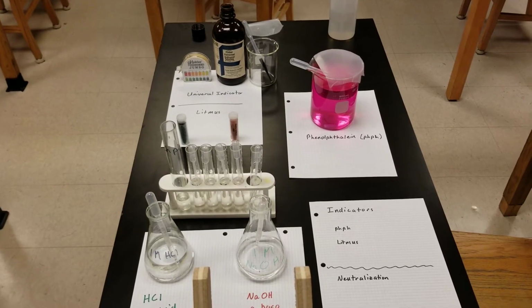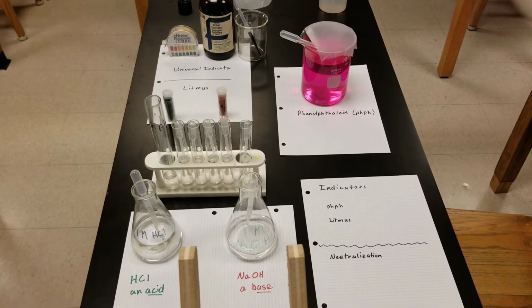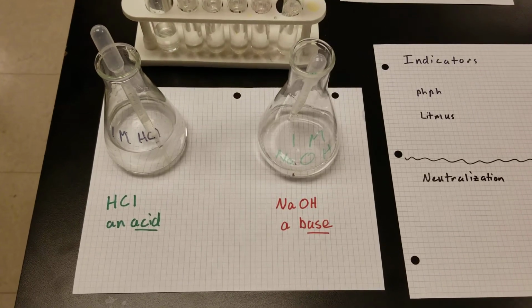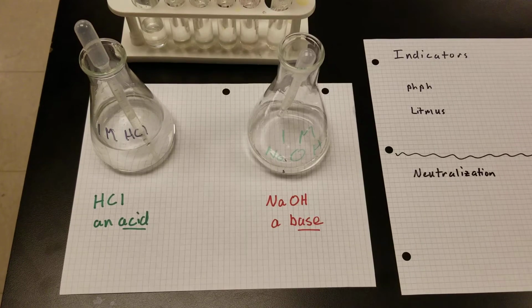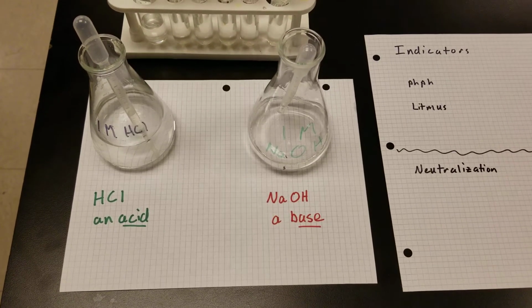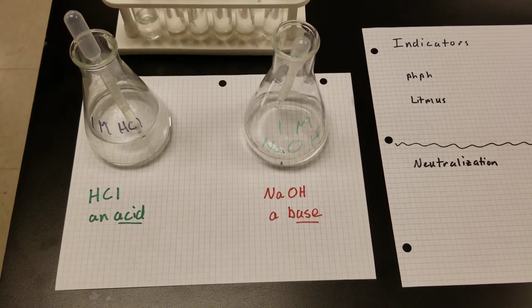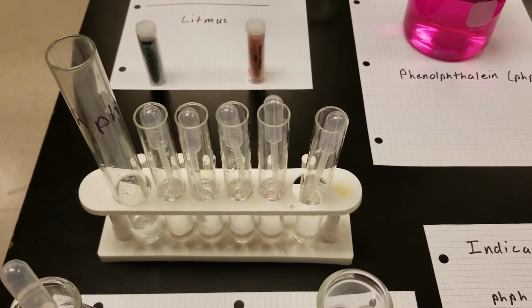Well, good morning. We're going to do a little bit of chemistry today, so let's have a look at some acids. Let's talk about our setup first. So I've got a strong acid and a strong base. The strong acid is HCl, and it's mixed so that they got about 1 mole of HCl for every liter of water. And the strong base is sodium hydroxide, NaOH, and it's mixed also so they got about 1 mole per liter of water. I've got some dilutions of acid and base.